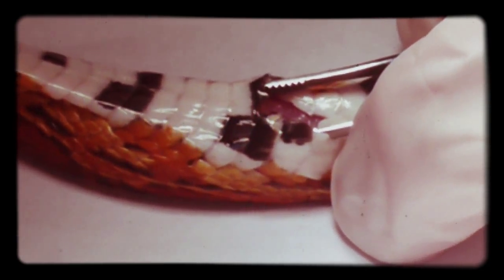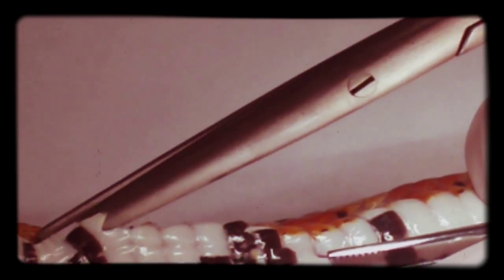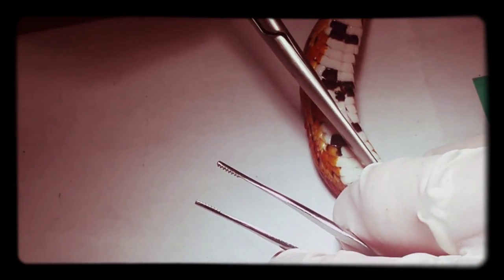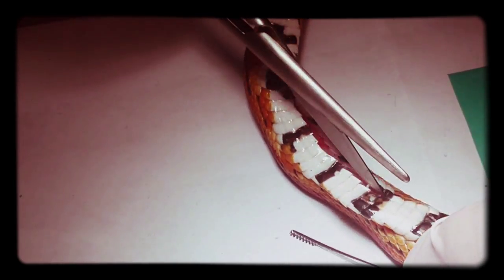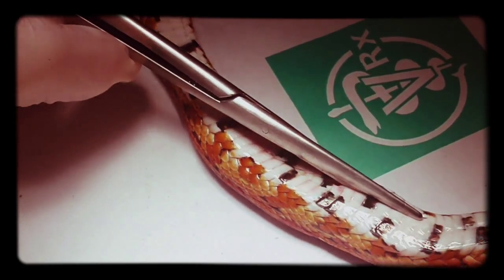Hey, it's okay. Okay, go up. Or maybe the scissors will work better. Let's see. Okay, and then I'll come back. Okay, and there's the lump. Okay, sorry.